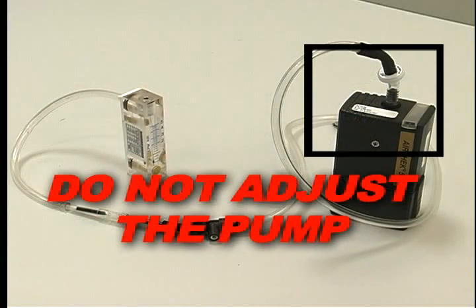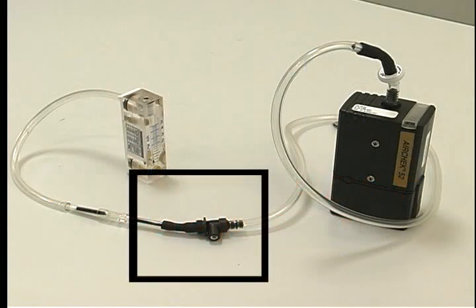Do not adjust the flow on the pump at this point. Only adjust the flow on the low flow holder.